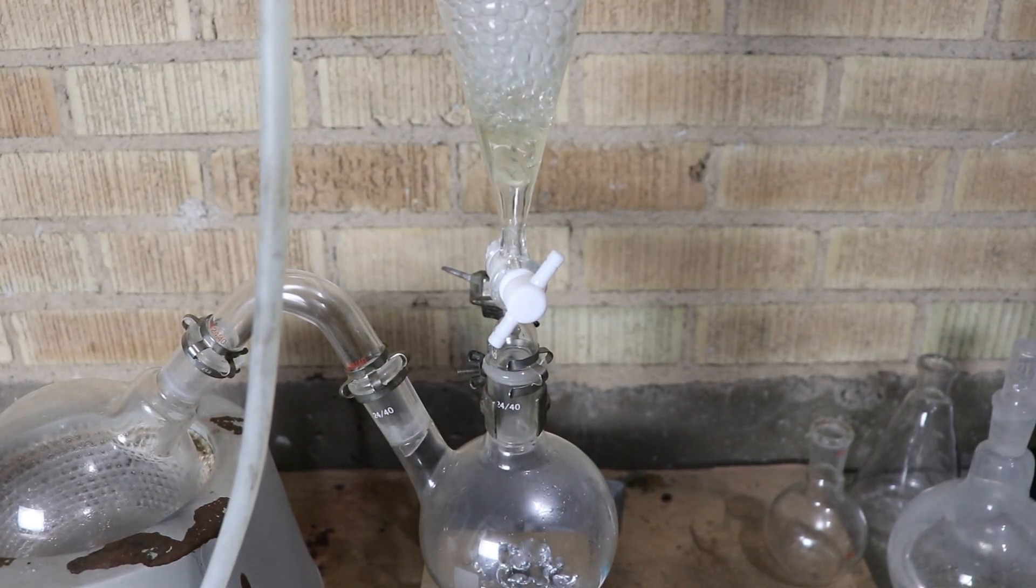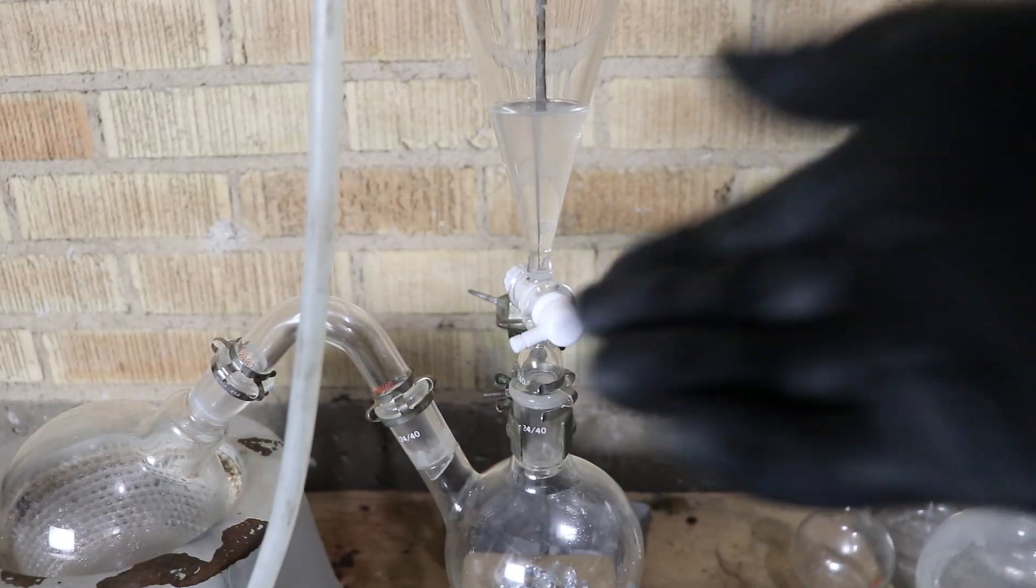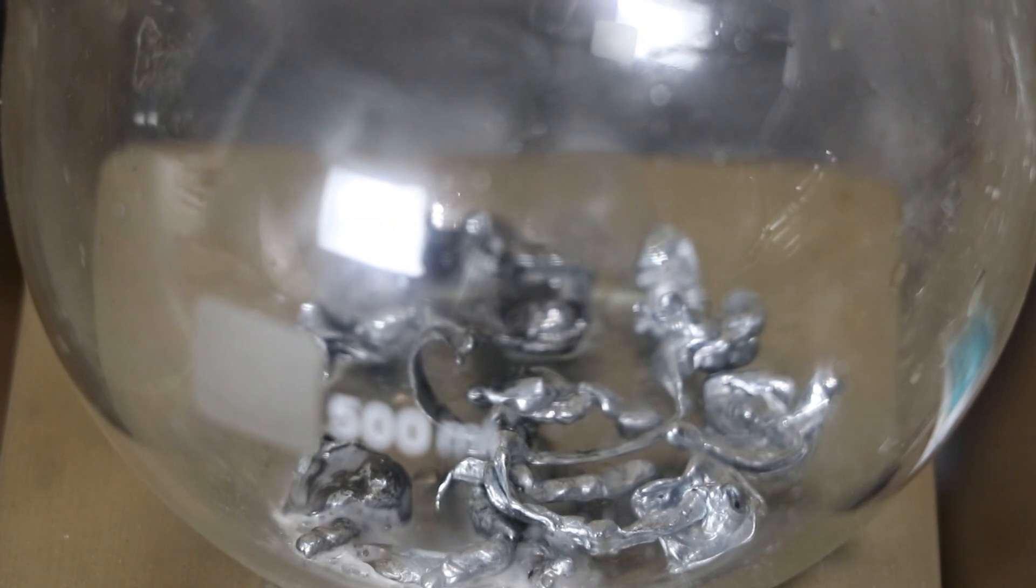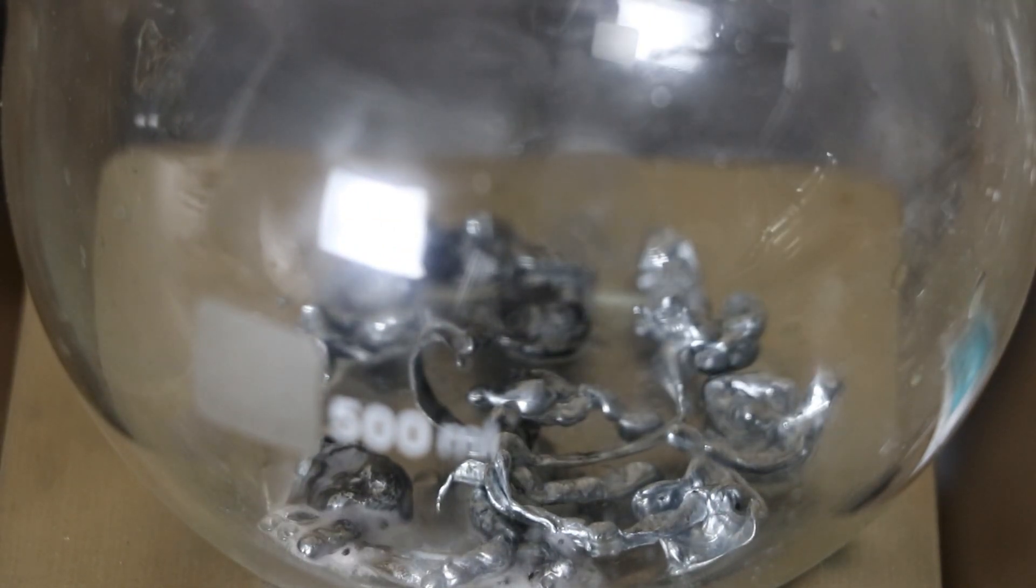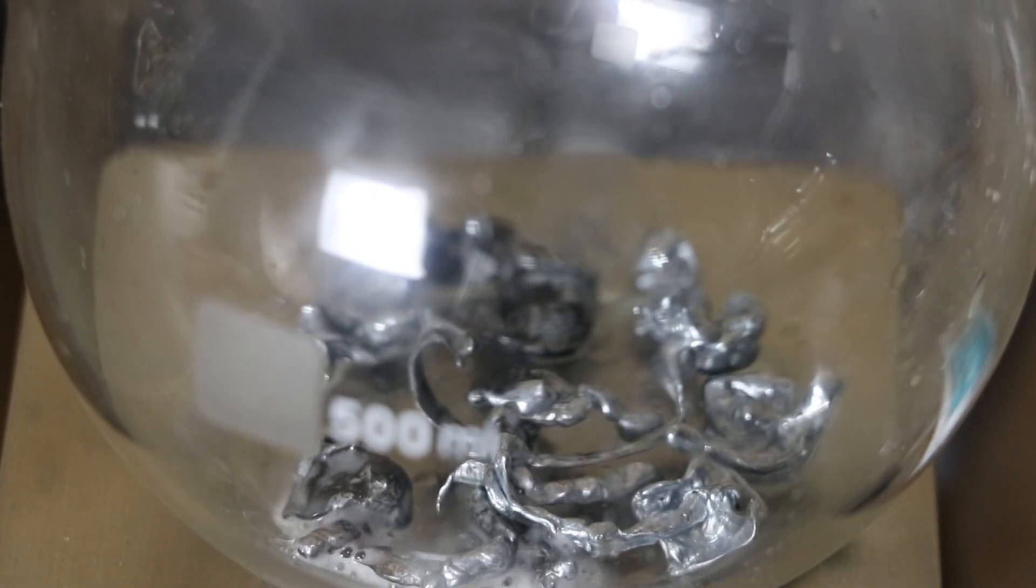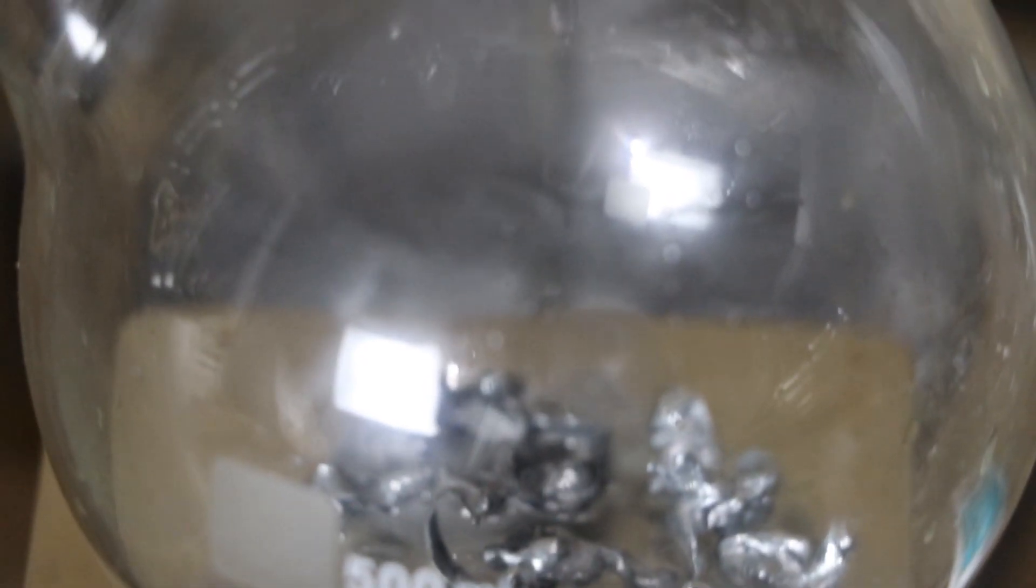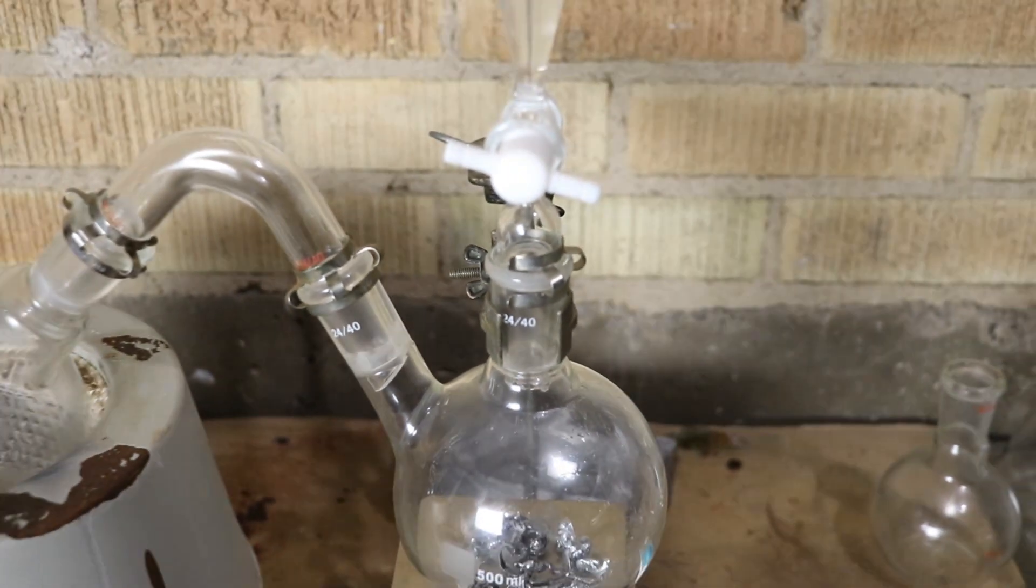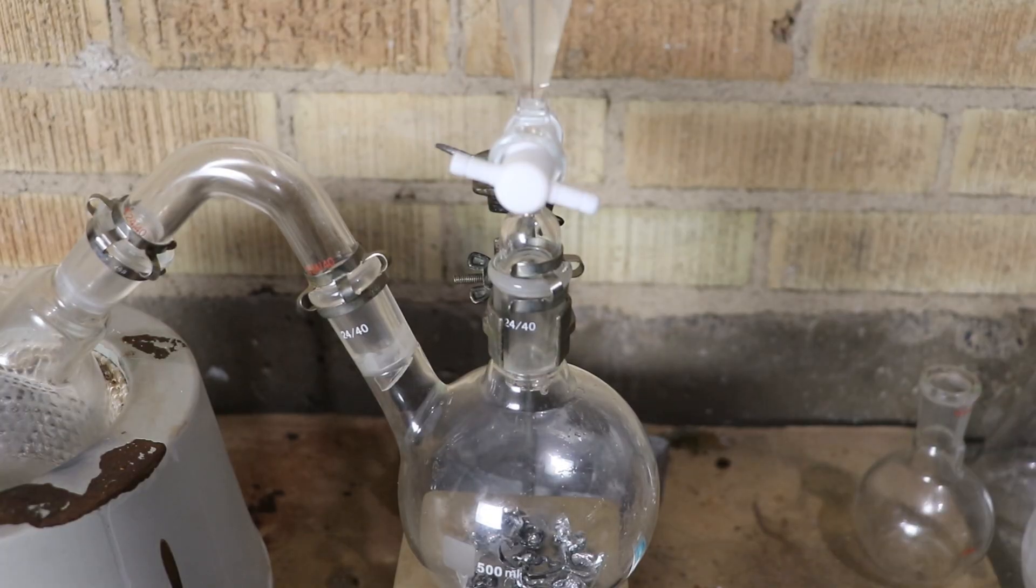Alright, it's going to be working. Alright, this seems to have worked. As you can see, there's a little bit of acid in there already reacting to zinc. I'm going to add in just a little bit more. Get this reaction going. Okay. And theoretically, once I've reached atmospheric pressure in here, more acid shouldn't fall out.